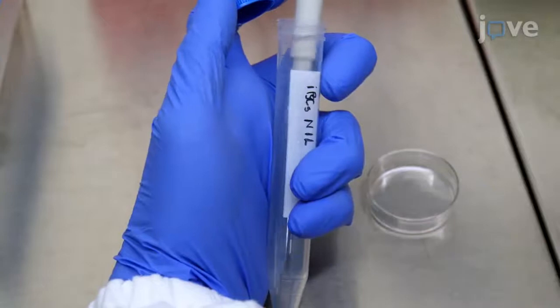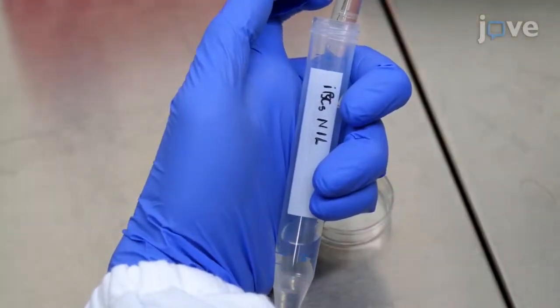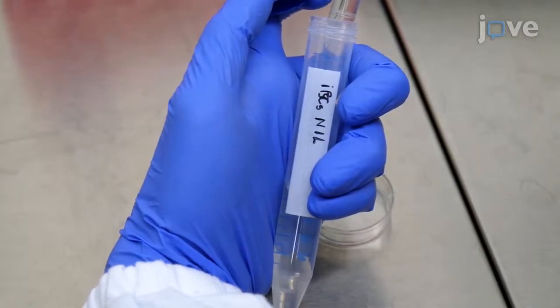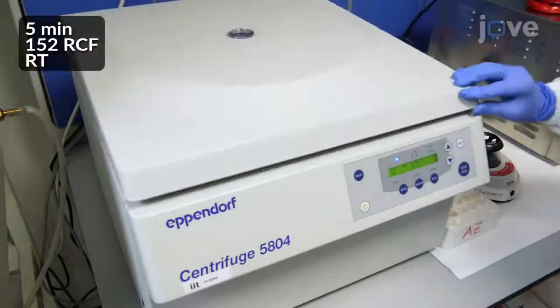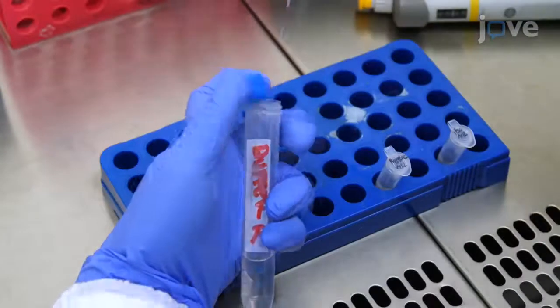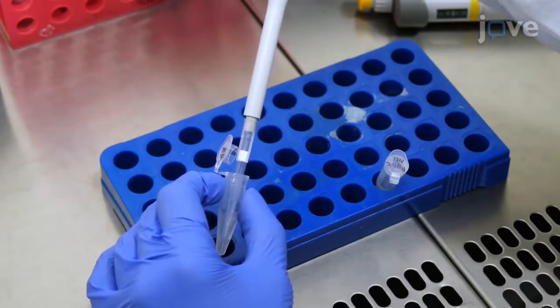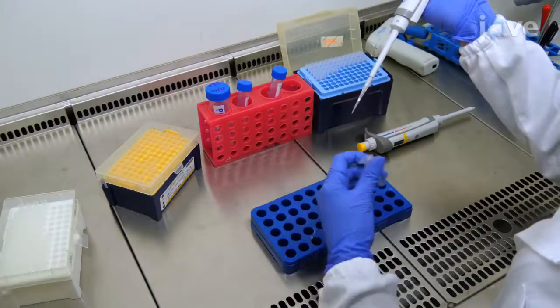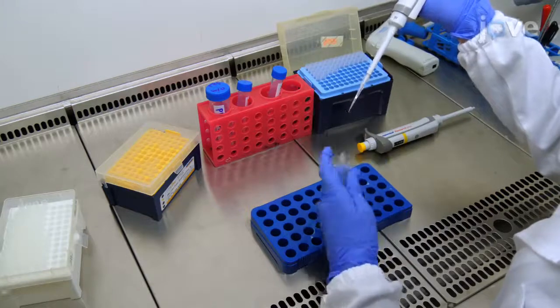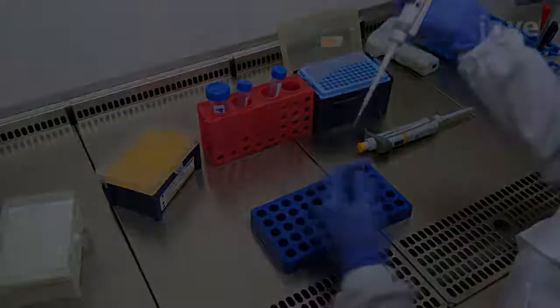Transfer the cells to a 15 milliliter tube and bring the final volume up to 10 milliliters with fresh PBS without calcium and magnesium for counting. Collect 1 × 10⁶ cells by centrifugation and resuspend the pellet in 100 microliters of buffer R from the electroporation kit. Add 4.5 micrograms of transposable vector plasmid DNA and 0.5 micrograms of the PiggyBac transposase plasmid DNA for transfection.